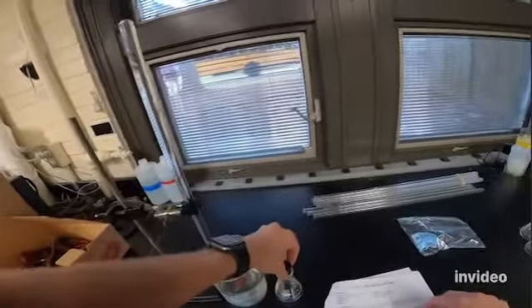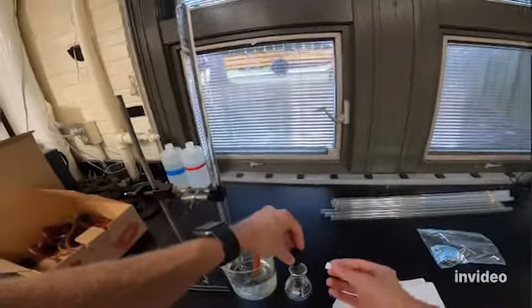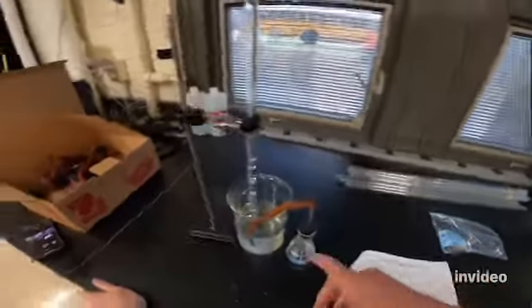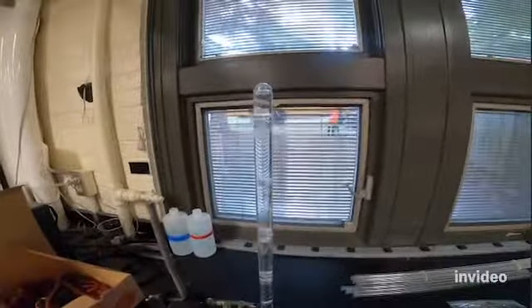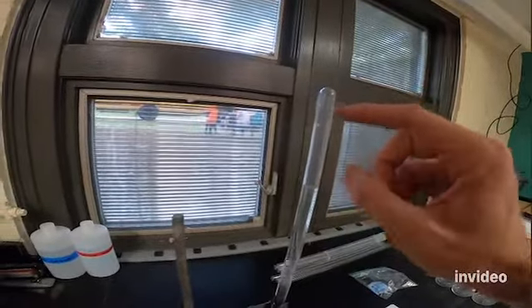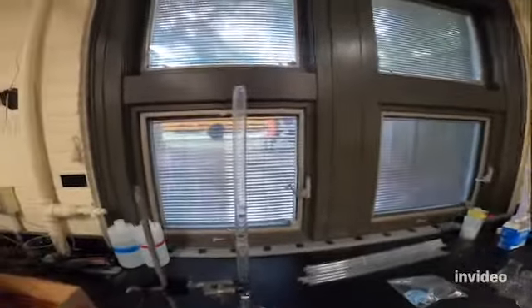So let's just see how that works. So I'm gonna drop my Alka-Seltzer in, and then I gotta be really quick about putting the flask stopper back on. So I drop it in, put the stopper on, and now as it bubbles, you can see those bubbles are starting to go up to the top of the eudiometer. And you can see that now we have a pocket of air that's forming at the top, and as it bubbles, that pocket of air is getting bigger and bigger.